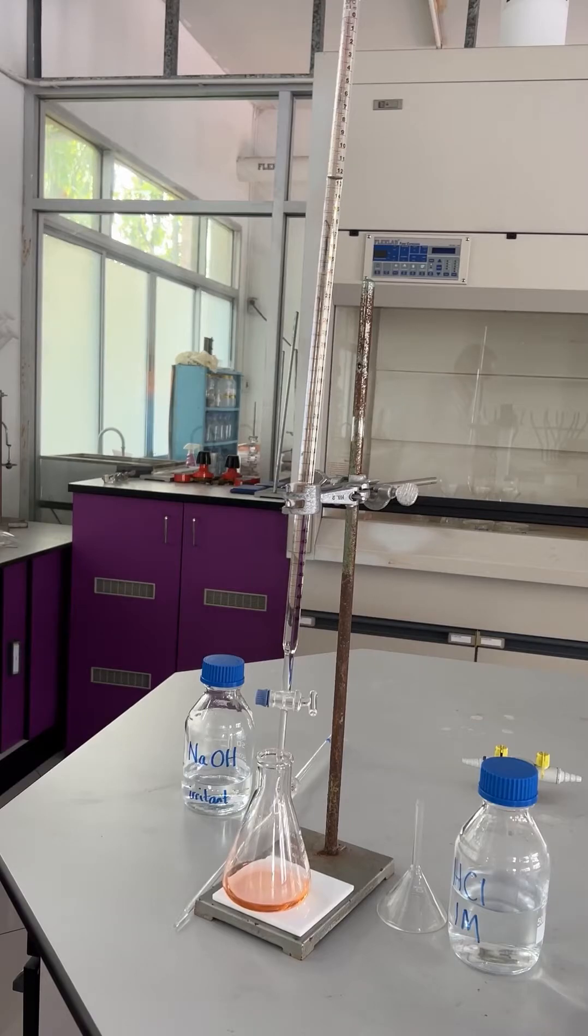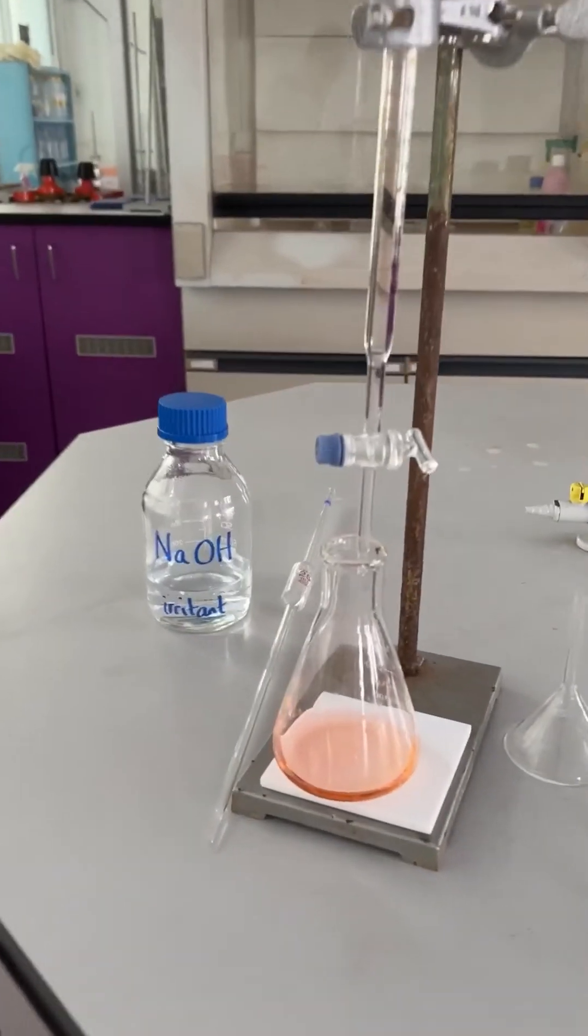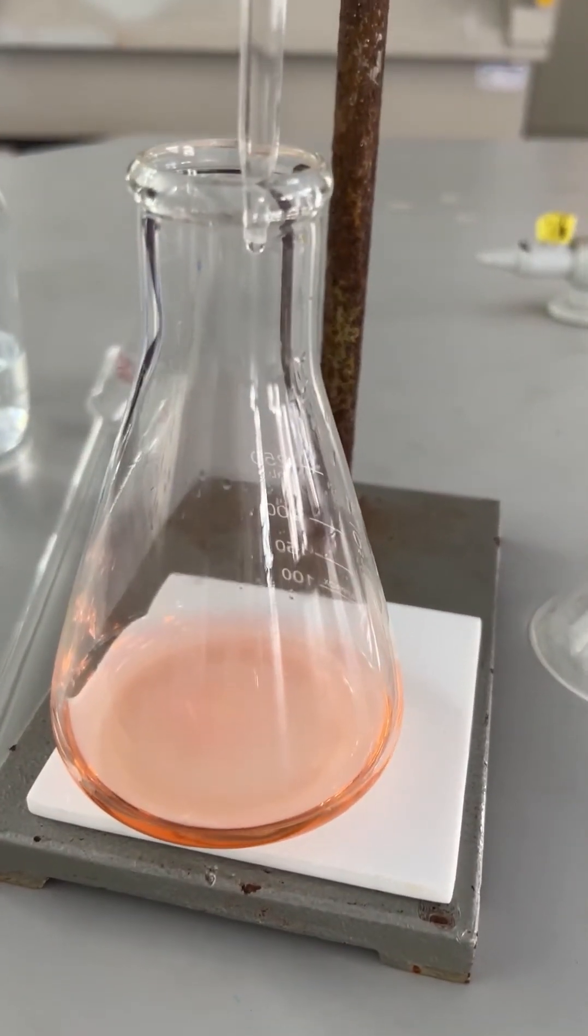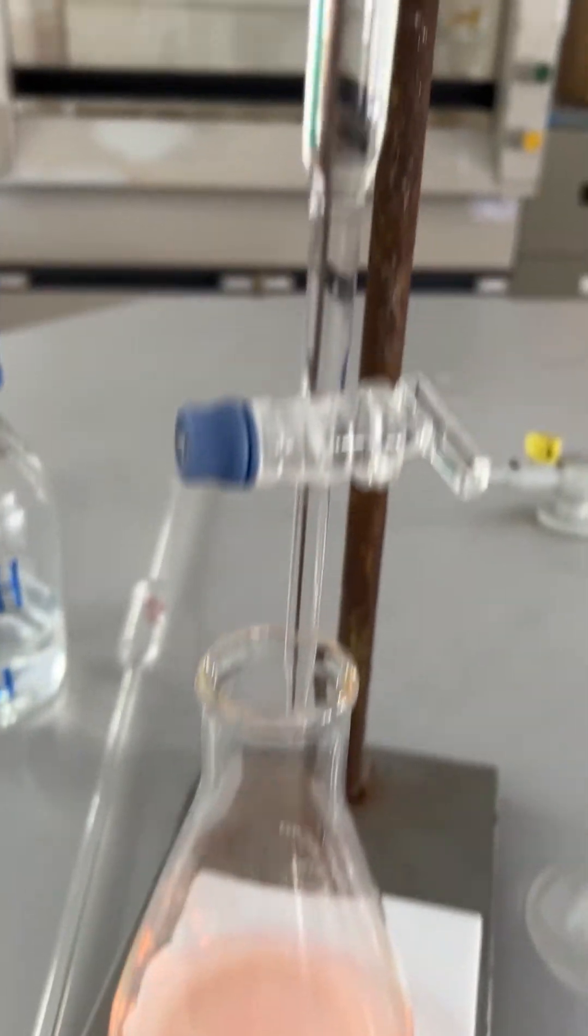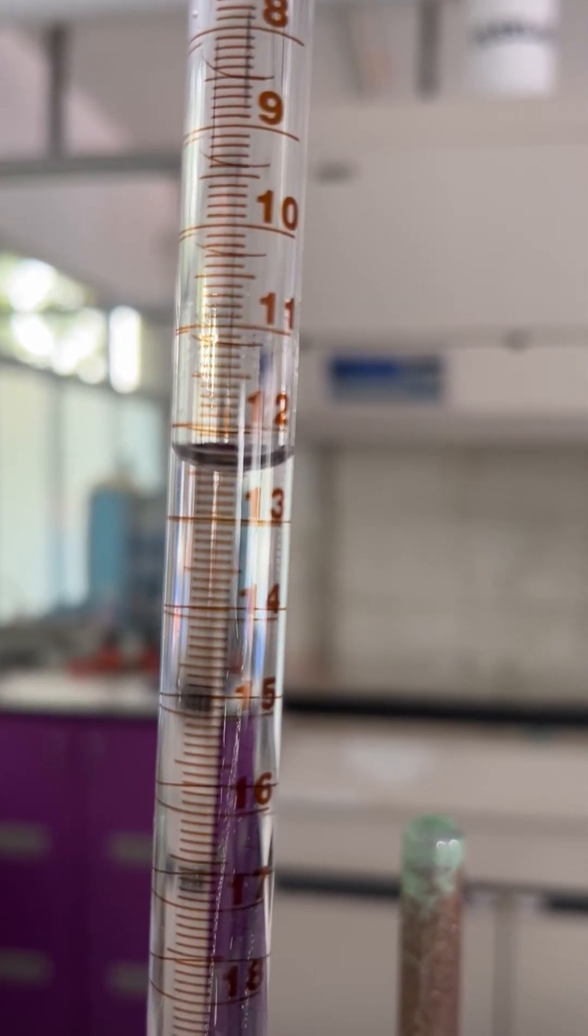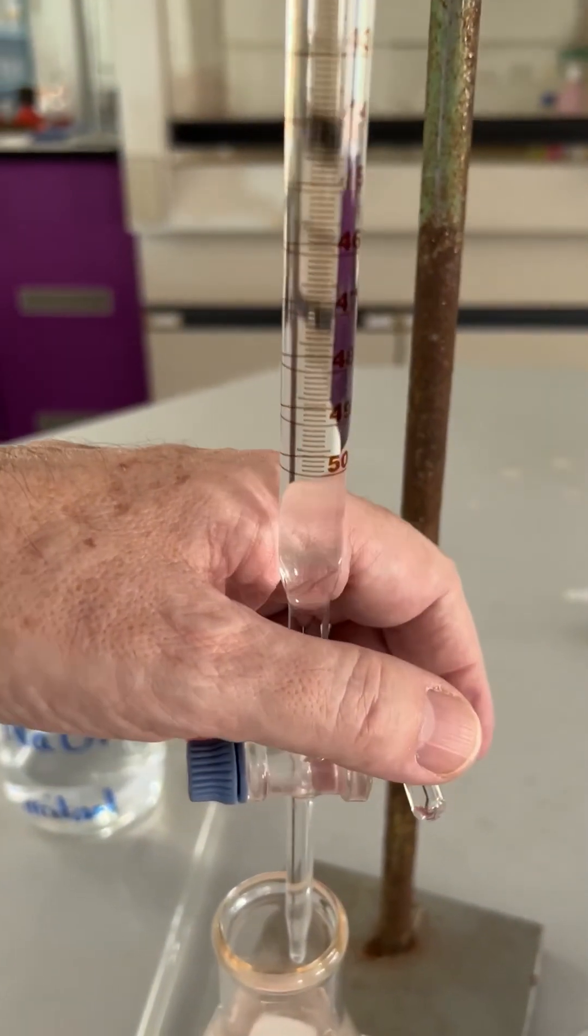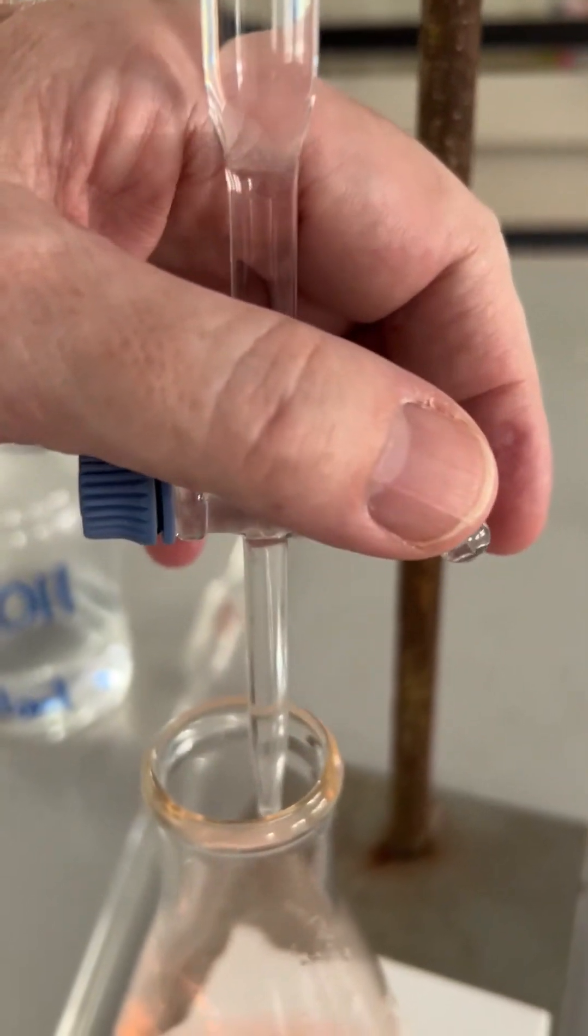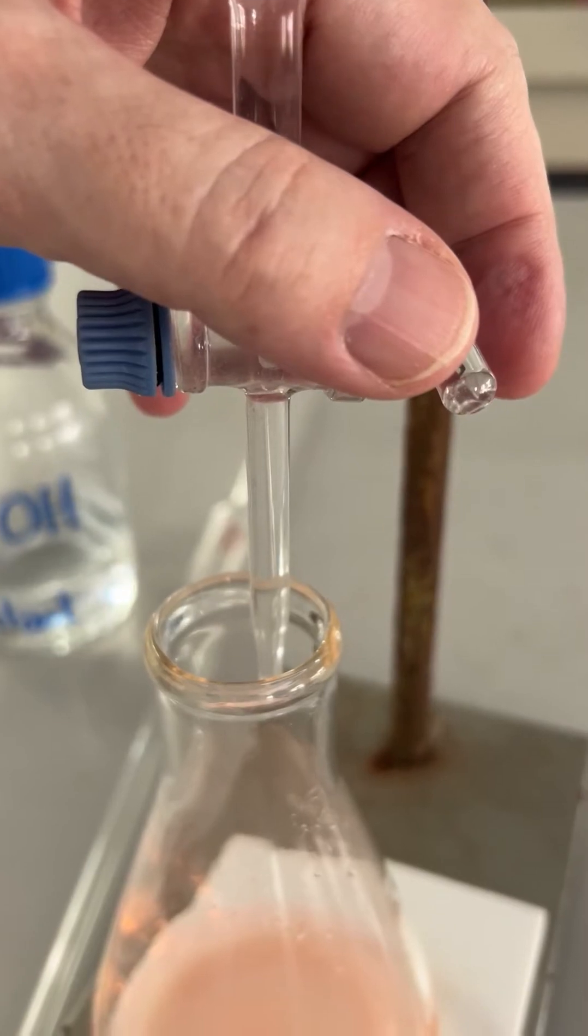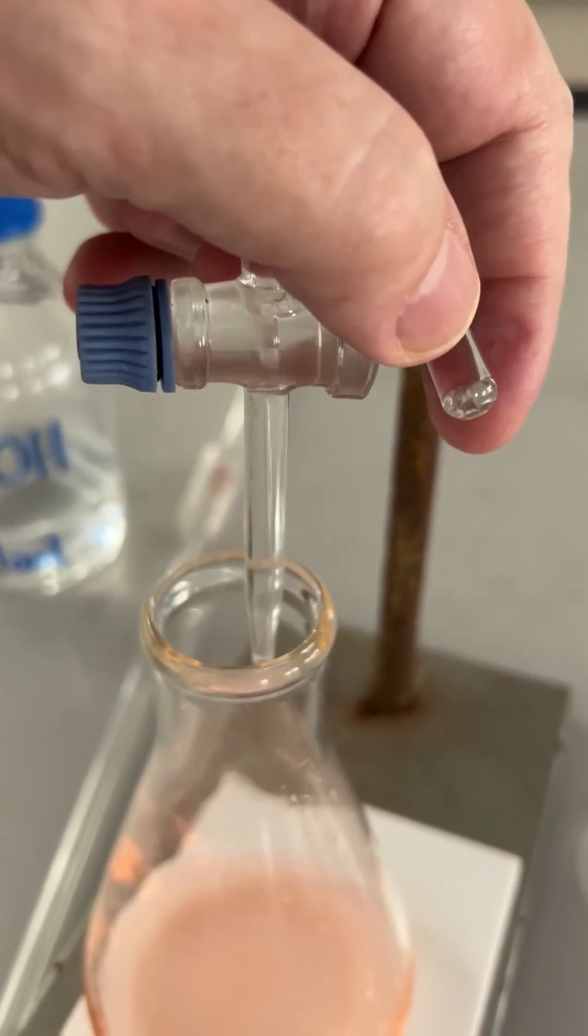So you can see we've got a peachy color mixed to that. Let's take a reading on the burette - that's about 12.5. Looking across... one more drop. Let's just verify that. Yes, 12.45 I would say. So one more drop.